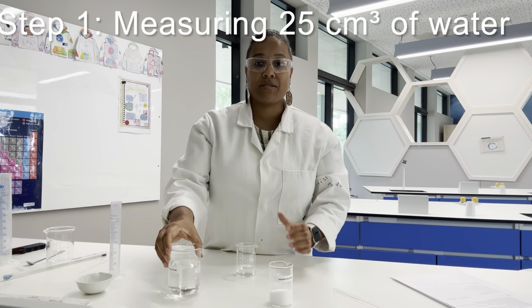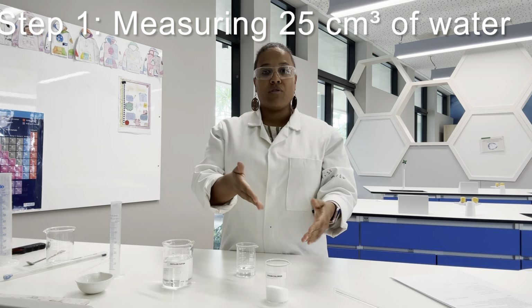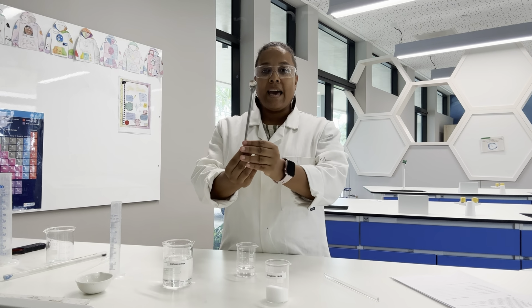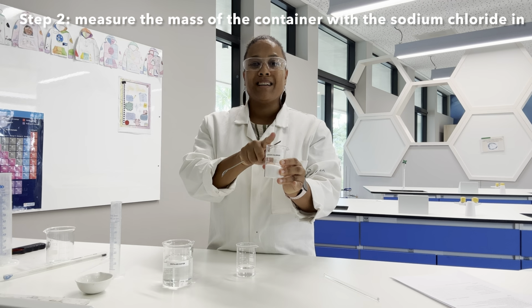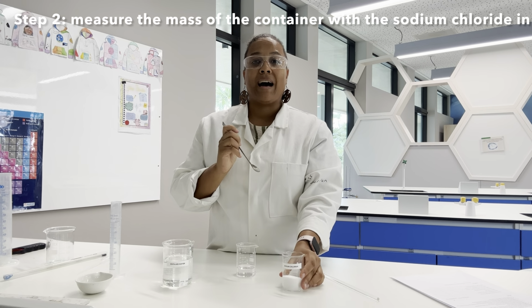Now, the whole premise of this experiment is that we are trying to work out how much of this sodium chloride will dissolve into that 25 centimetre cubed of water. So I've got here a spatula. Now, I have measured the mass of this beaker containing sodium chloride. That's very important so that we can weigh it at the end to work out how much we've added.